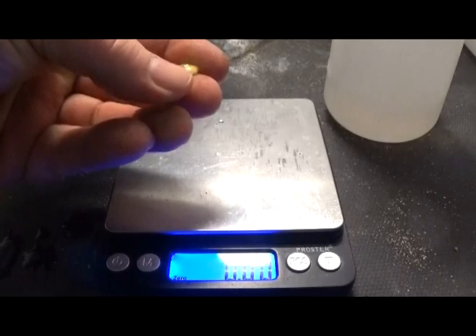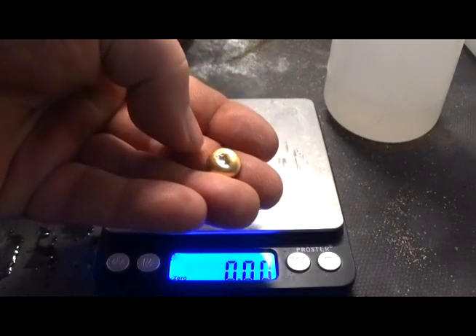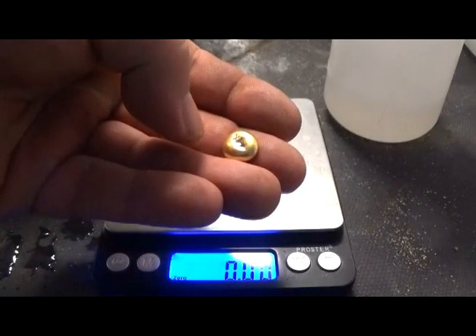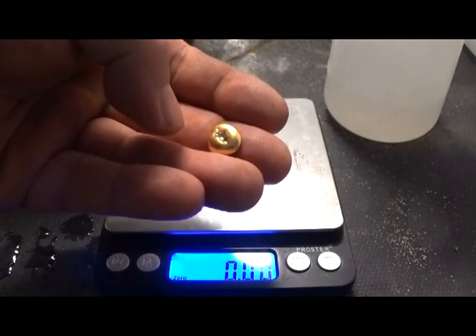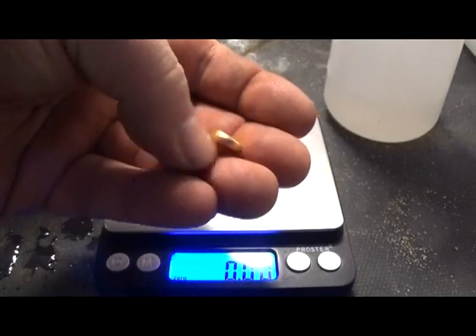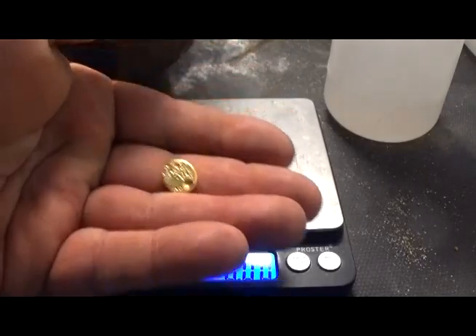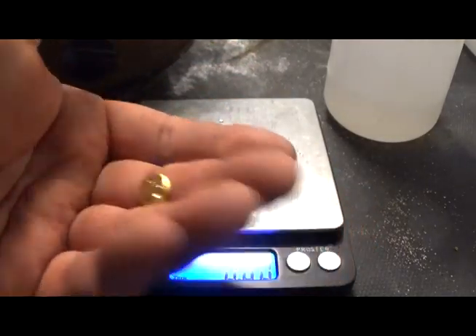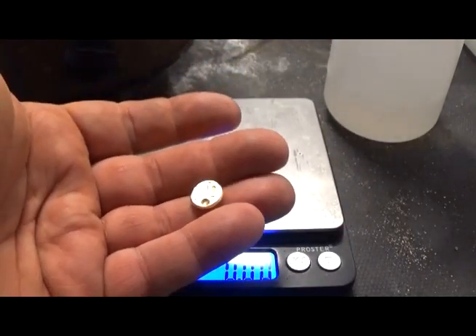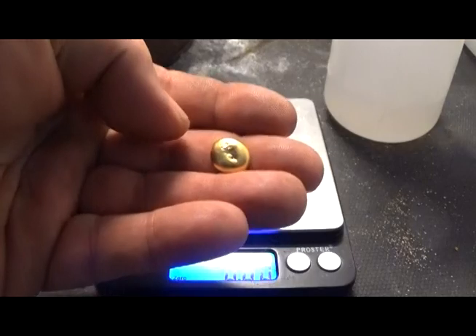I was going off of the 3.5 grams of 14 karat gold that it was refining. And I forgot about the 3.5 grams of gold powder that I did have. And not to mention the 80 to 100 grams of gold filled material that I had. So yeah, it all works out. I completely forgot about that. And I was just concentrating on the 1.5 grams of 14 karat gold that we stamped the little crosses into. So we're gonna get this stamped up, put our mark on it, and call it a day. All right, we'll show you when we're done.